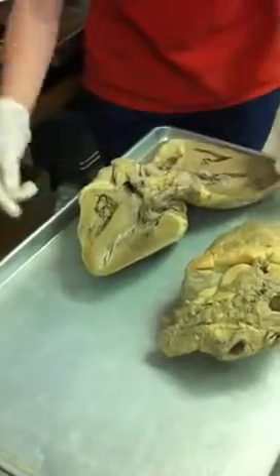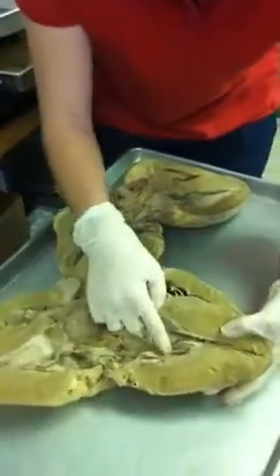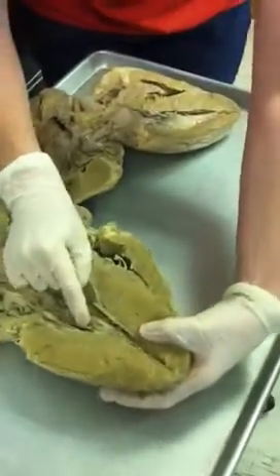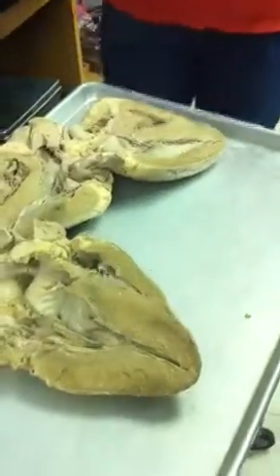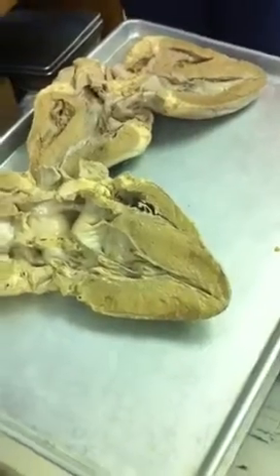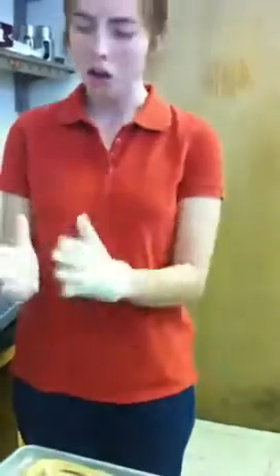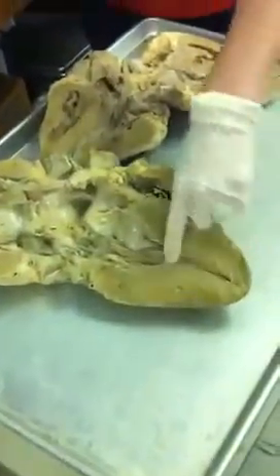Let me give you an example. At the bottom of this chordae tendineae, does everybody see that thickening at the bottom? That's the papillary muscle. The whole function of the chordae tendineae and the papillary muscle is to prevent the valve from prolapsing into the atrium. It's like a balloon on a rope attached to a weight. No matter how hard the wind blows, that balloon is never going to rise higher because it's tethered. That's the whole point of the chordae tendineae and the papillary muscle.